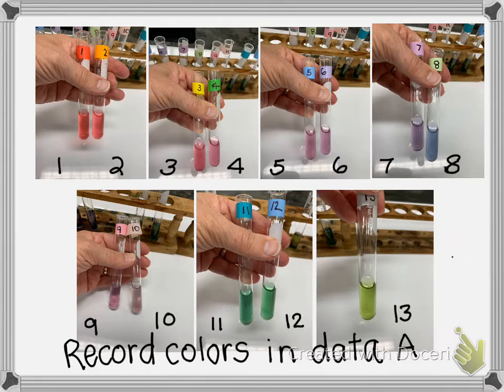So if you're having trouble distinguishing, you may reach out to a classmate or a friend or someone else that can help you distinguish the colors. The most important thing is that even if you're not seeing the exact same color as someone else, we're trying to be able to distinguish and compare colors. So this is a limitation, and you do the best you can with it.